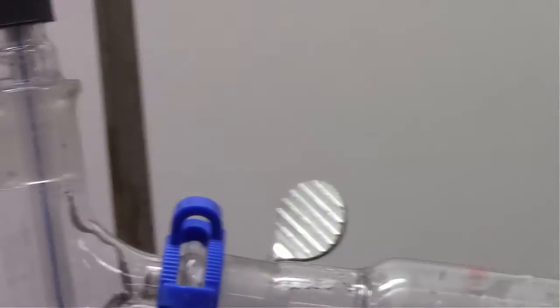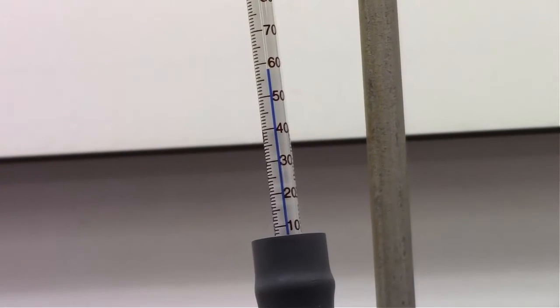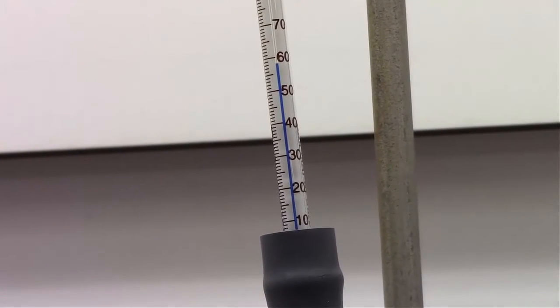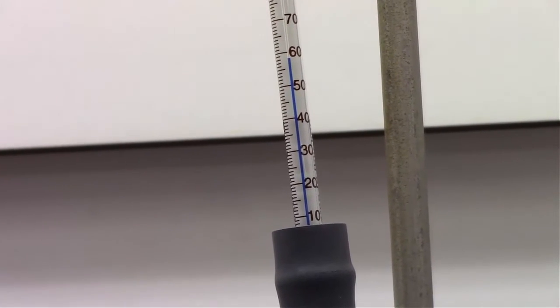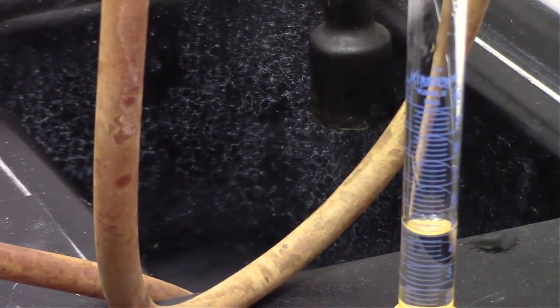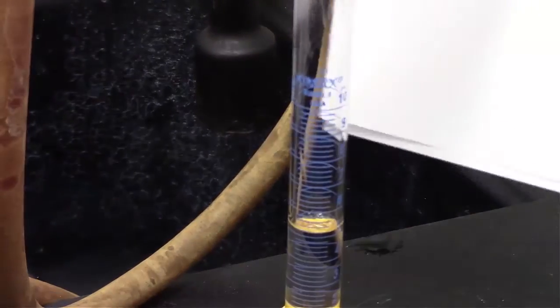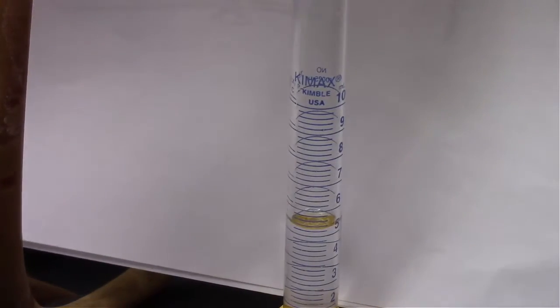And slowly we're watching each drop of acetone being collected. Ideally, in a lab situation, we could graph this. We're ideally even graphing more than every two milliliters and seeing what that temperature is. But I wouldn't be surprised if the temperature was fairly consistent around 58 degrees Celsius for all of the acetone being collected. So as we're collecting this liquid based on the temperature at which the condensation evaporation is happening, we can be pretty confident that if we are right around 58 degrees Celsius, we're collecting 100% acetone.